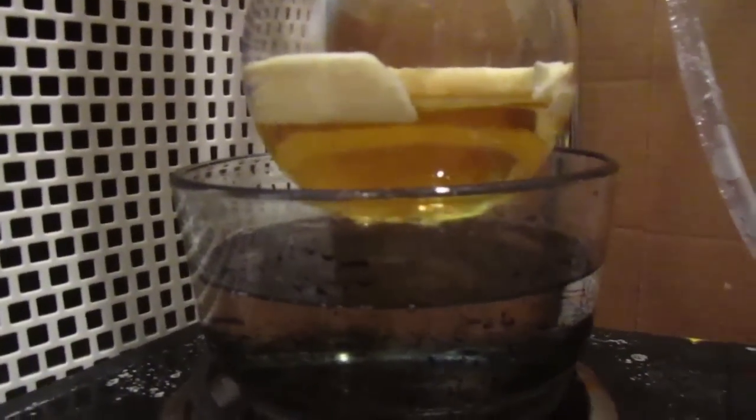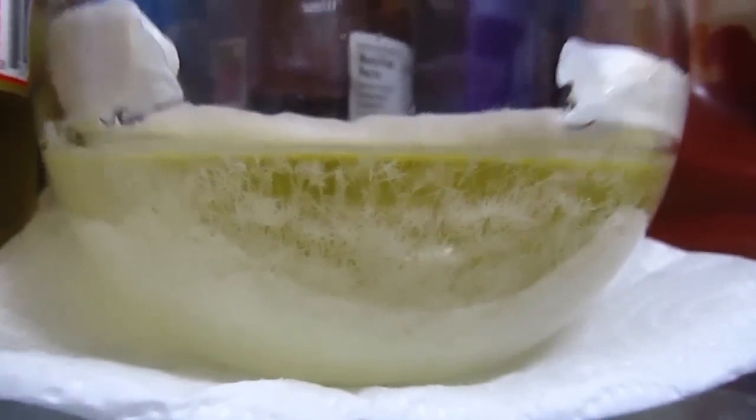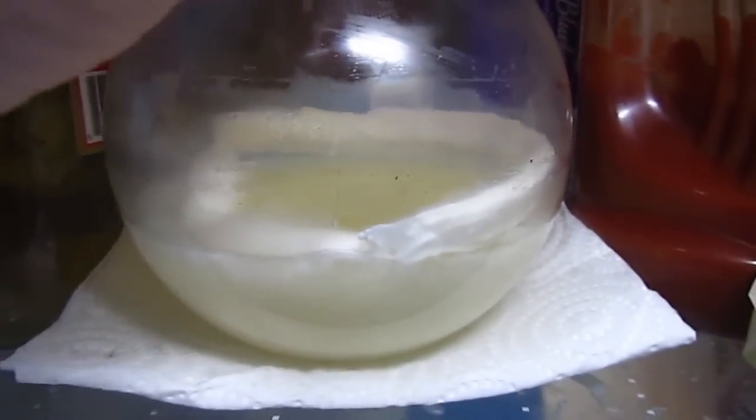But took it off of the hot plate and I put it in the fridge. This is after about an hour, and it crystals nicely. And overnight, completely crystallized, I got a yield of 55 out of 60 grams and I was okay with that.